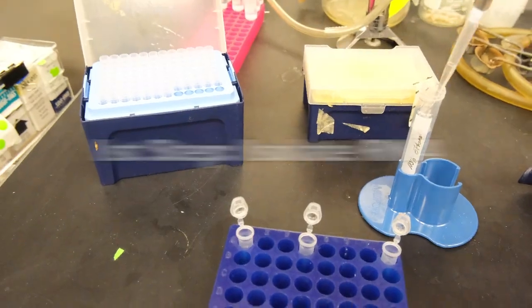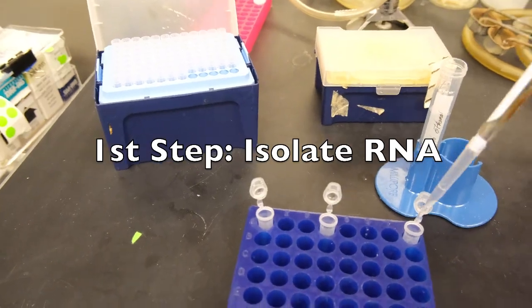Let's go over PCR, polymerase chain reaction. PCR is a technique used to amplify a specific segment of DNA. qPCR, quantitative PCR, or real-time PCR is basically the exact same process, just has a fluorescent dye that measures the amount. Now let's get started.